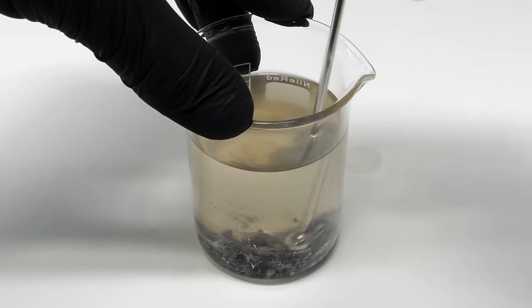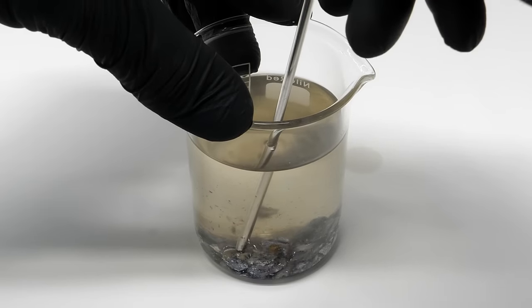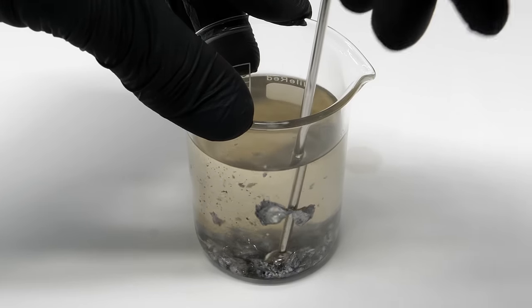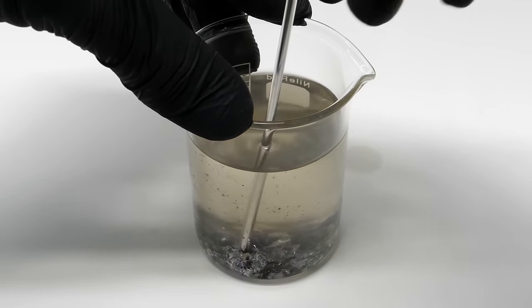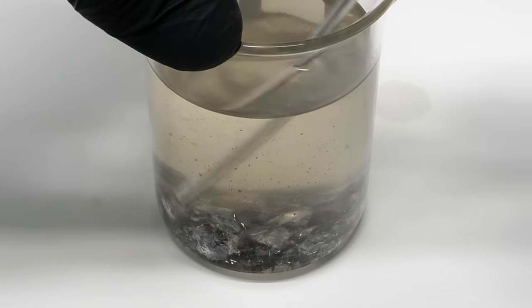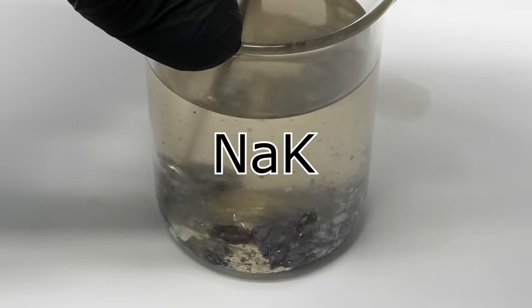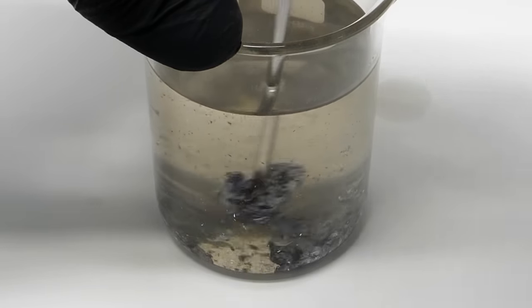Using this other tool, I can squeeze the pieces together and hopefully force the sodium and potassium to combine. This should make a sodium and potassium alloy, also known as NaK, which is a super reactive liquid.